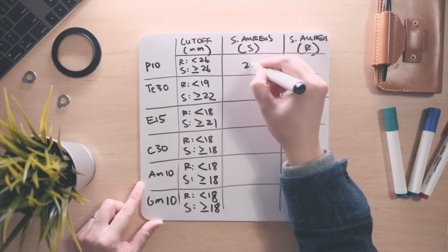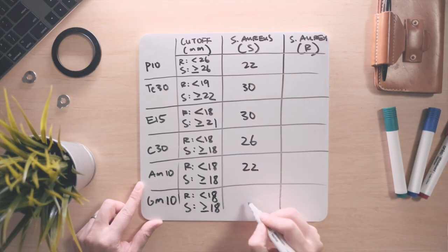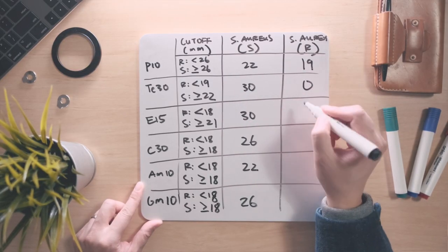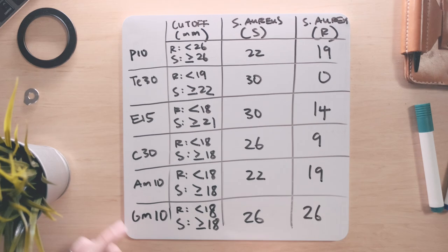Let's come back to Staphylococcus aureus. If we measure the diameter of the zones of inhibition in millimeters, here are the readings for each antibiotic for the sensitive and resistant strains. Using the cutoffs on screen, can you figure out which antibiotics these two strains of Staphylococcus are sensitive or resistant to?